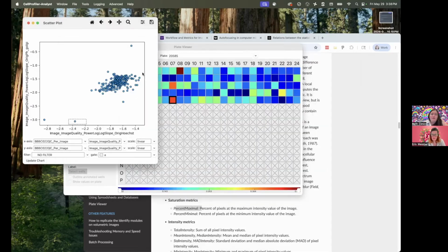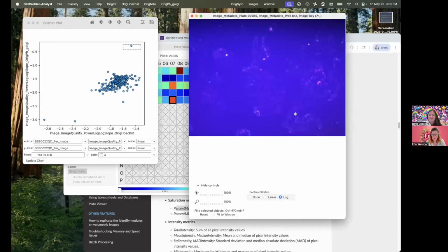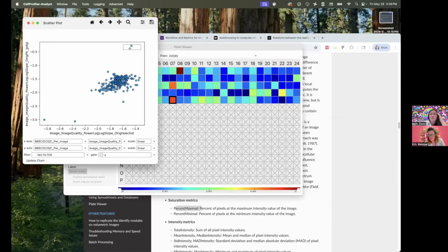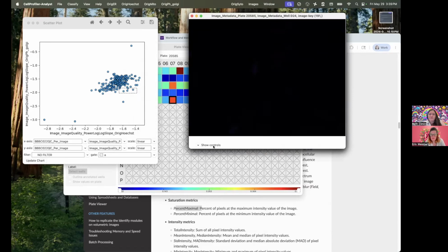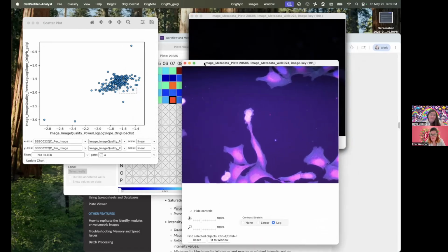And to my point about channels, here, for example, is that power log slope metric across two different channels, the nuclear channel and the Golgi channel. The first thing I'll draw your attention to is that the scales of these are different. And even this central blob here is not perfectly on a diagonal. There is some scatter around here, so the power log slope in one channel versus the other might be different. We can look at some of the outliers here and say, yep, this image sure looks terrible. It's basically empty, so clearly this is a bad image. But some of these might be perfectly analyzable, just a little bit empty.